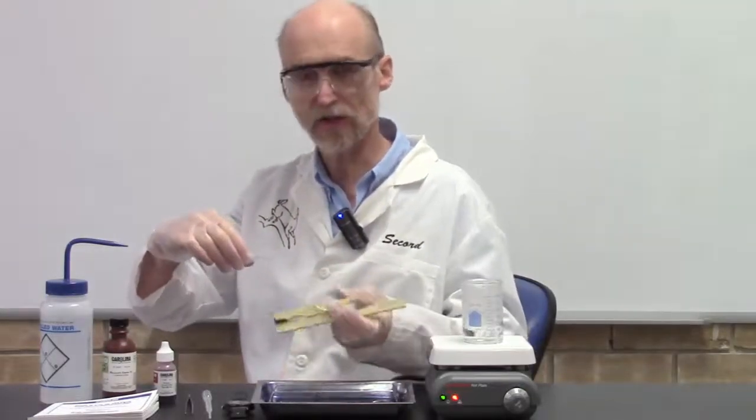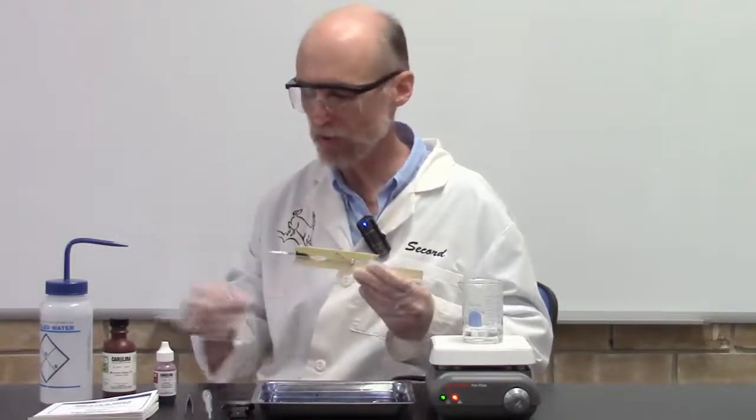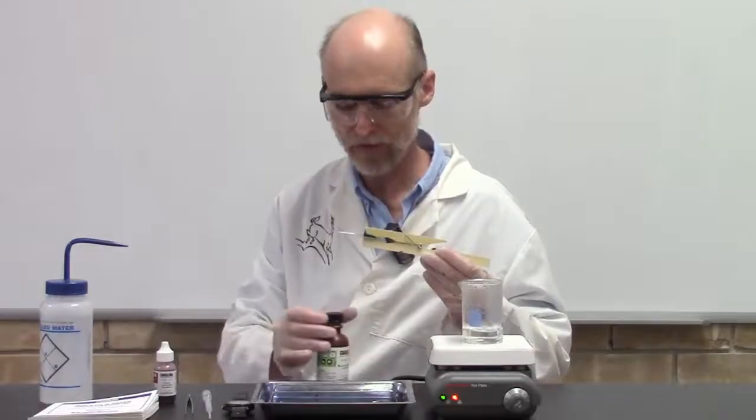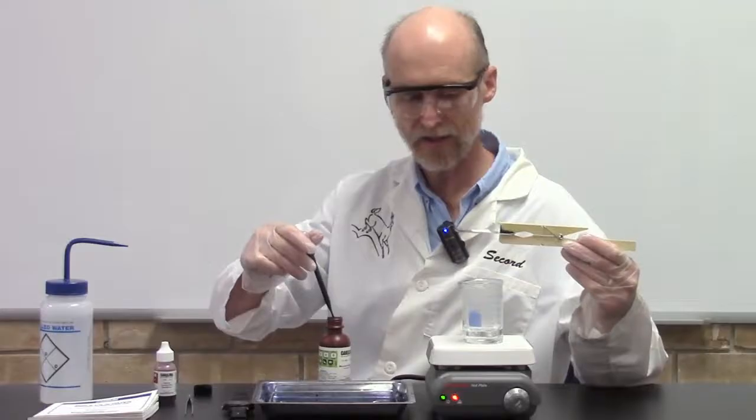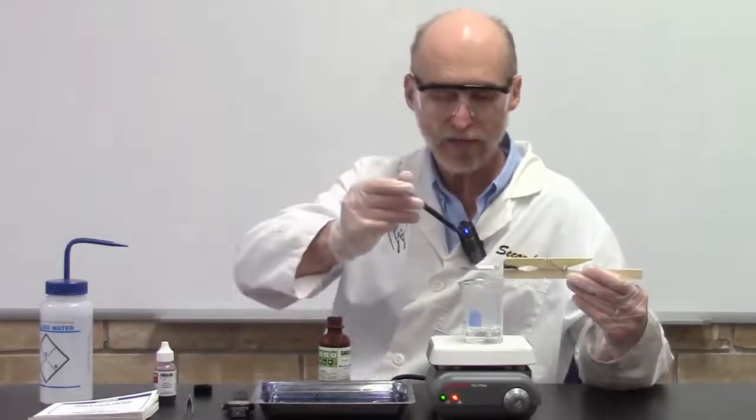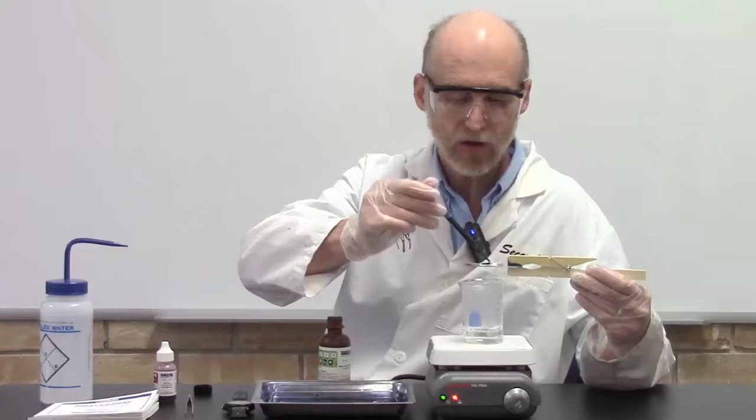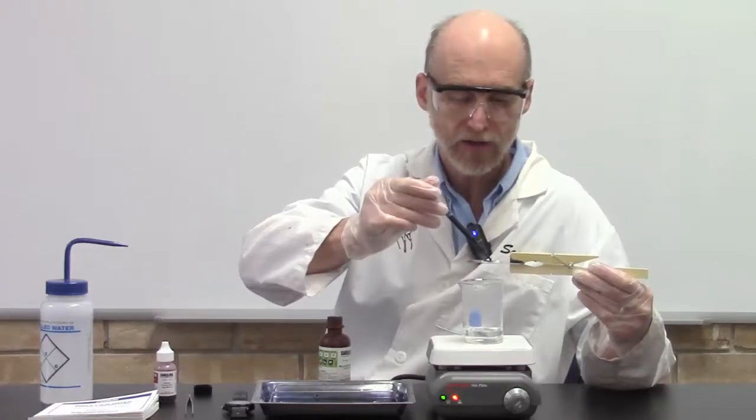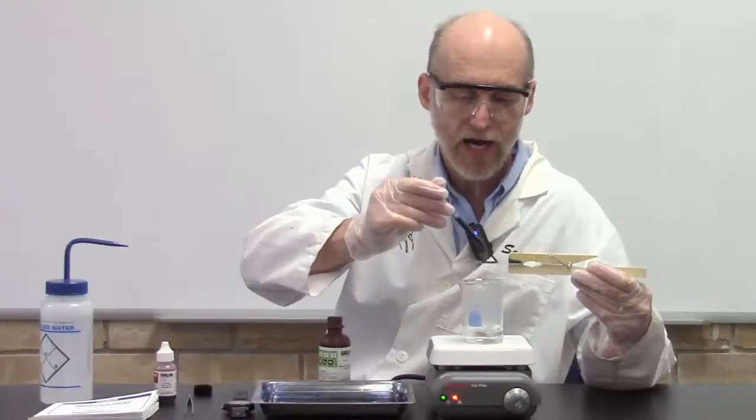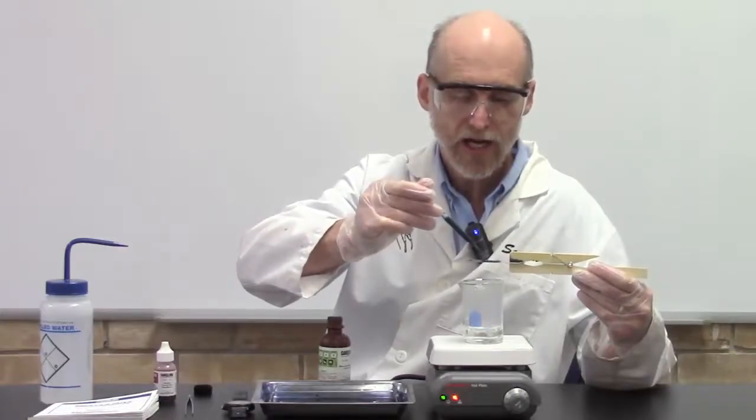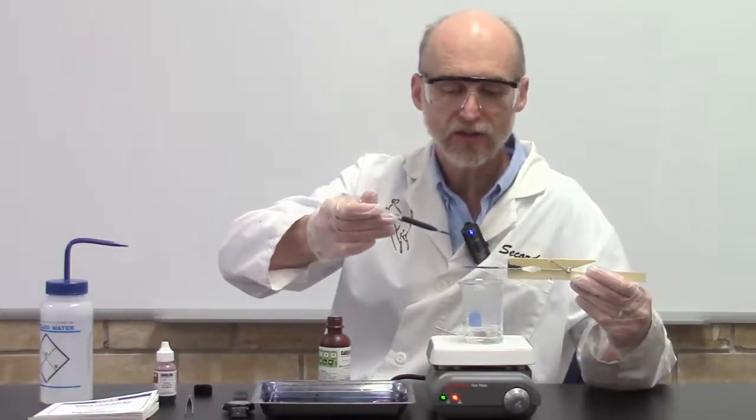So we're ready to start staining. I'm going to take my spore stain, put my slide over the steam bath, and apply malachite green for three minutes. I'm going to hold it over the bacterial smear. Now what you do is you keep this paper moist. Don't let it dry out. So you kind of have to babysit it.